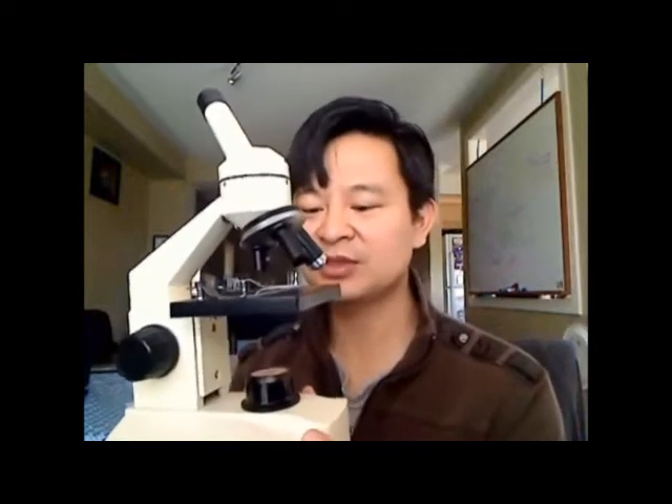Welcome back to EducateTube.com, my name is Zipsky, your host today. I'm going to talk about how to hook up a USB camera — a cheap VGA or SVGA camera. Make sure that this USB camera has a manual focus. You can get one on eBay for around 15 to 17 bucks — it's quite cheap.